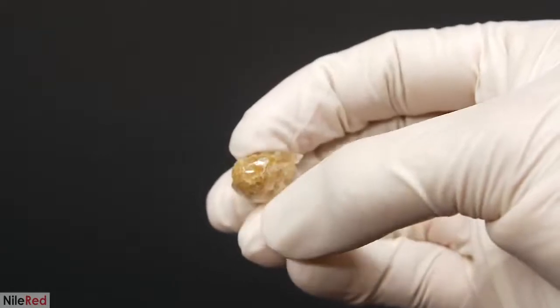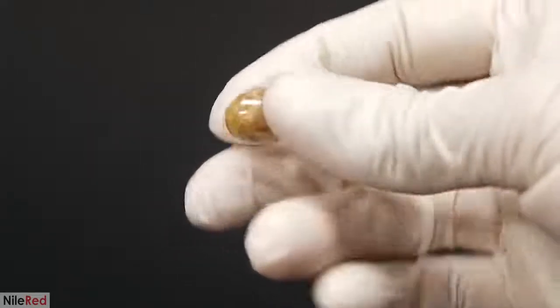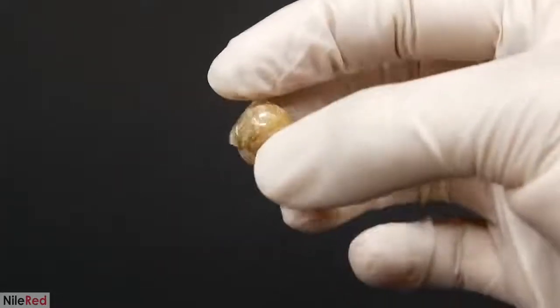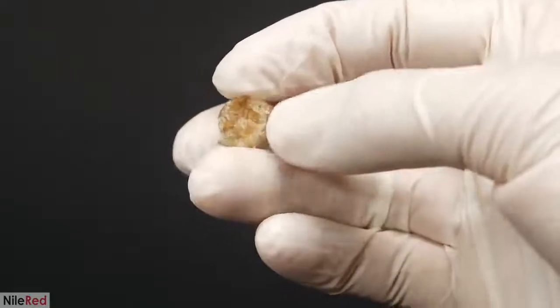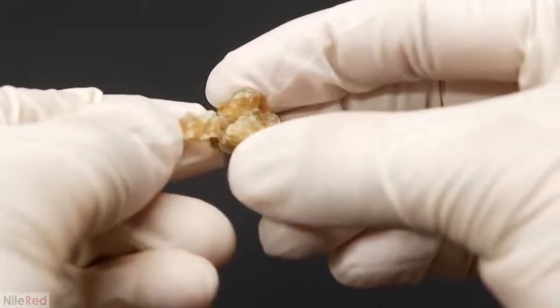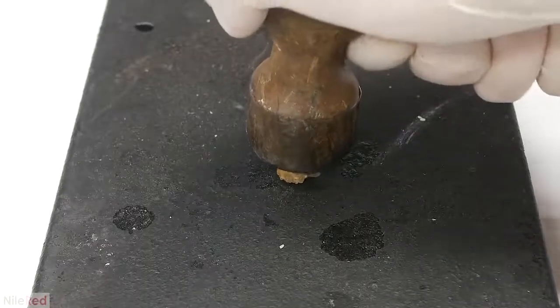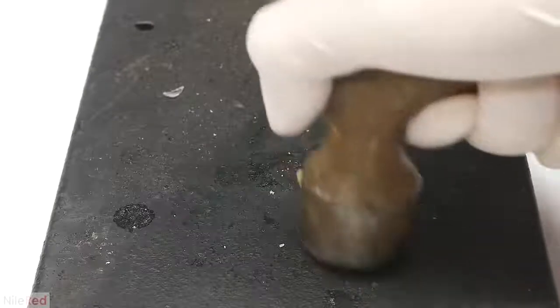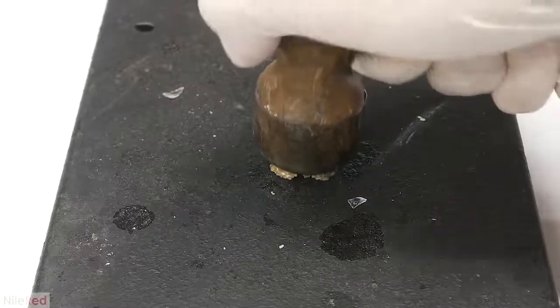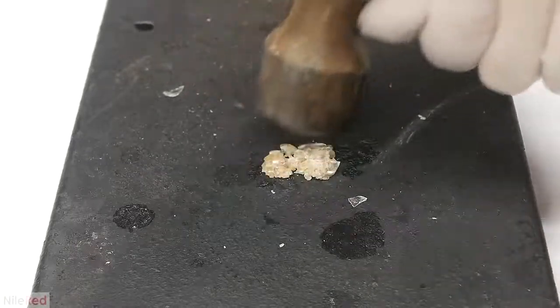This time though, when I smashed the test tube, I ran into a problem. With the added triacetin, the cellulose acetate became a lot stickier and softer, and the glass didn't really want to come off. I tried to remove some of the glass manually, but the thing kind of just started falling apart. I went to do another hammer test, but smashing it this time doesn't really make any sense, so I just squished it.